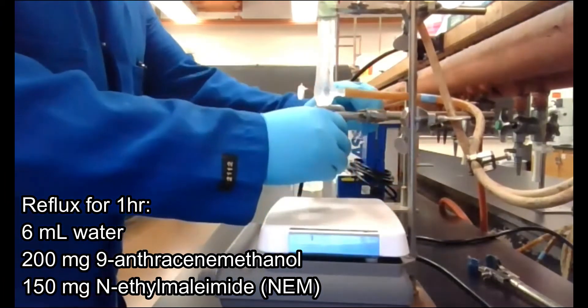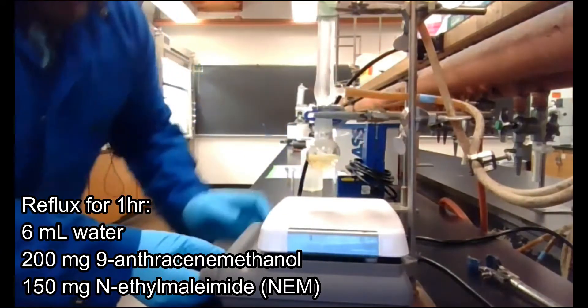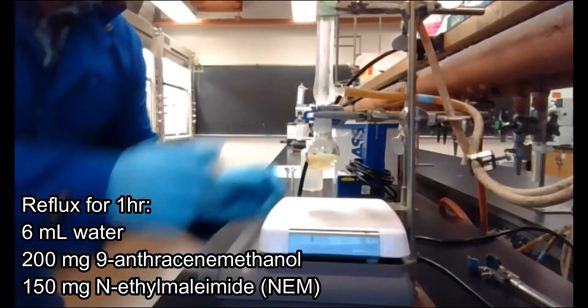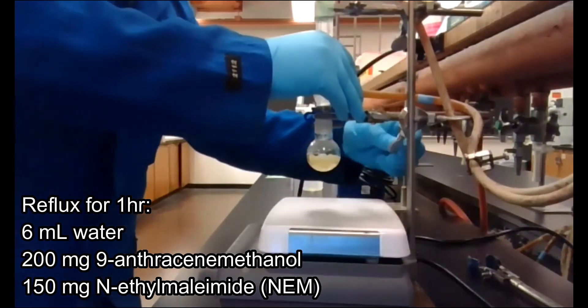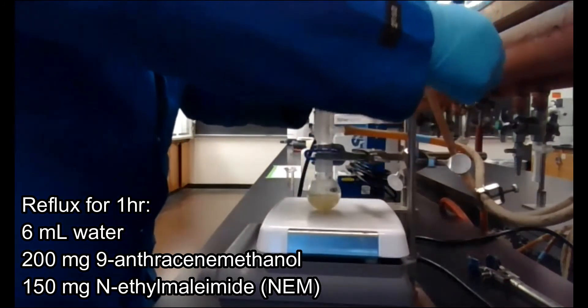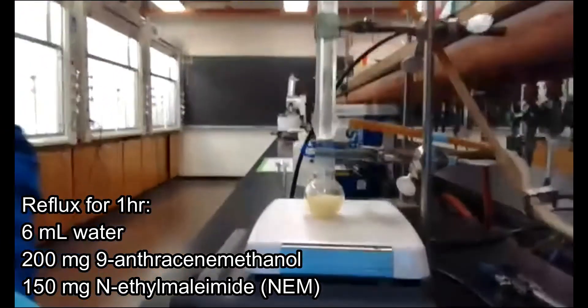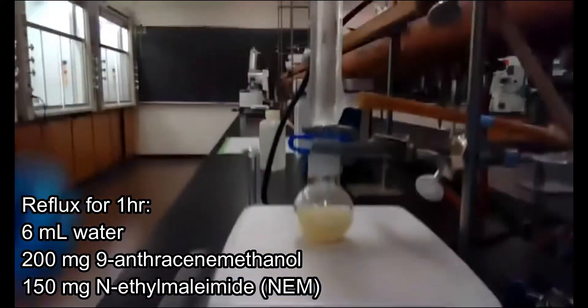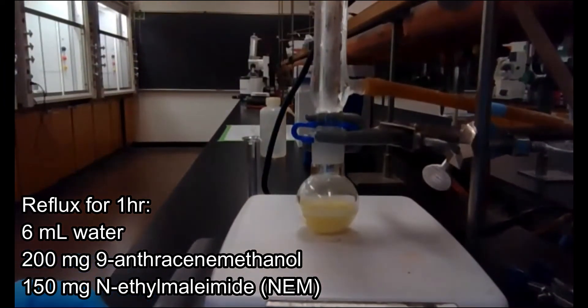And I'm going to turn on the stirring and heat. I'm going to drop this down so it's touching the stir plate, and we're just going to reflux this just directly on the stir plate. We're not going to set up a sand bath. We're going to go ahead and let that stir, and we'll let that come up to reflux, and it will reflux for an hour.